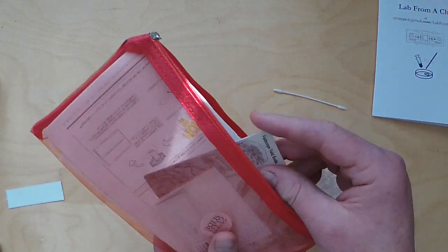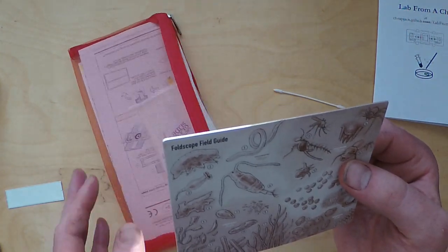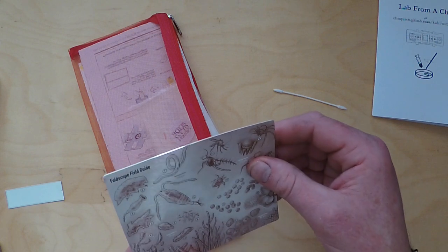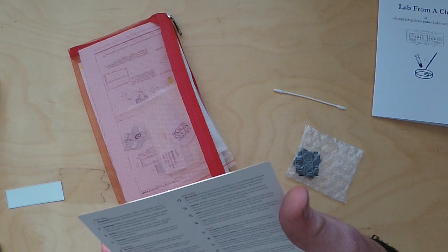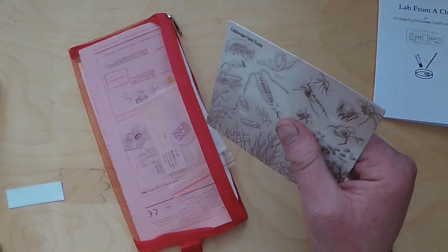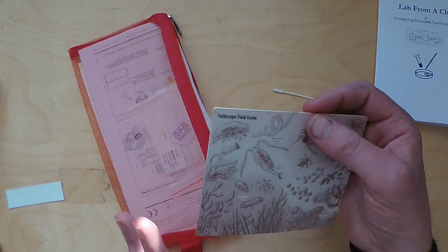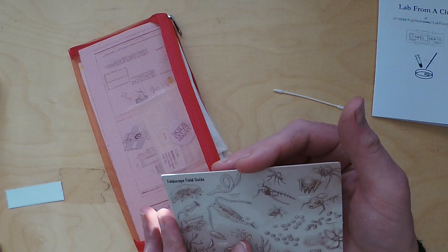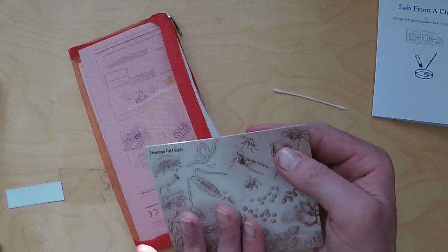You also get quite a nice piece of artwork by the Foldscope people showing the different organisms that you might be able to see with the Foldscope. Euglena are not actually on here, but there are many other organisms you'd be able to see - from nematode worms, another famous model organism, to tardigrades which are quite exotic things. Unfortunately we don't have any tardigrades for you but maybe that's another project.